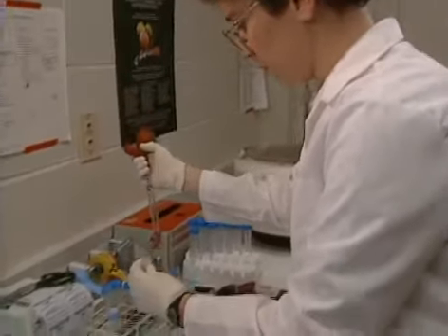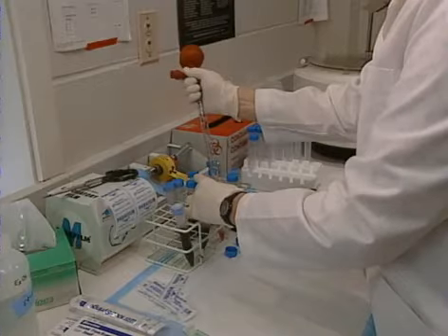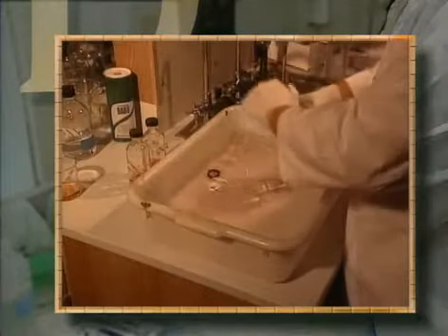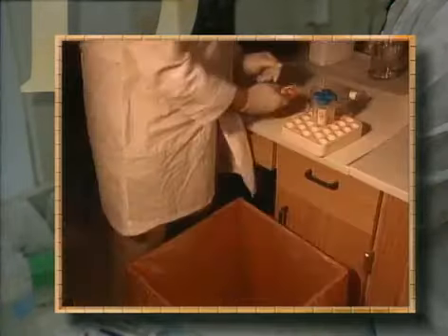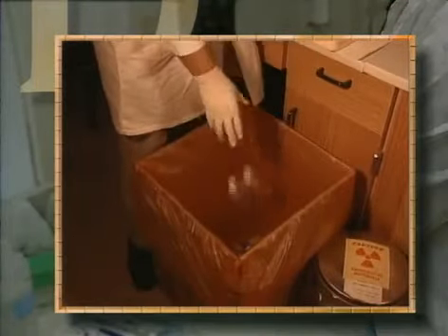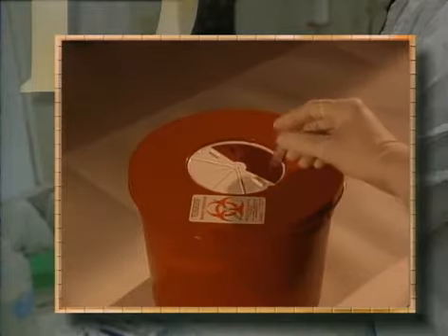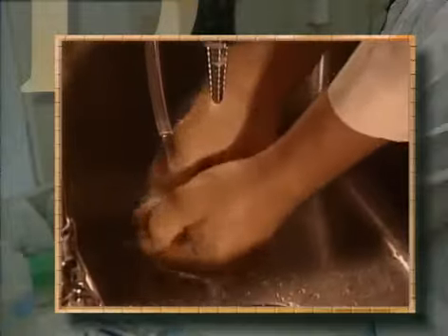And speaking of good lab practices, if your work involves handling human blood or tissues, grade yourself on whether you are 100% consistent about doing each of these important safety steps. Making sure all glassware and other disposables are appropriately decontaminated before washing. Disposing of all contaminated materials according to the regulations of your host institution. Keeping your wits about you when disposing of sharps so they don't end up someplace where they'll be a hazard for the housekeeping staff. Washing your hands thoroughly when finished, even though you've been wearing gloves.